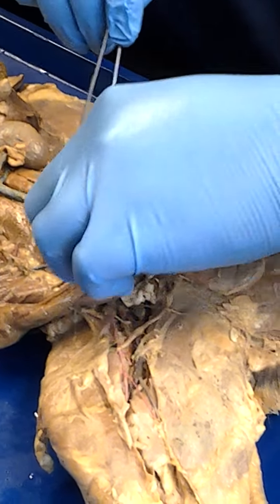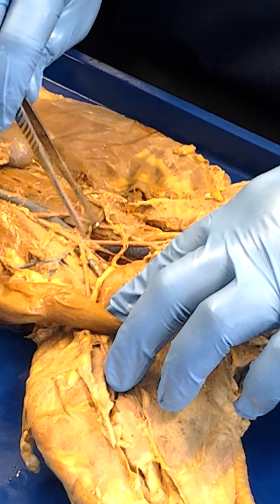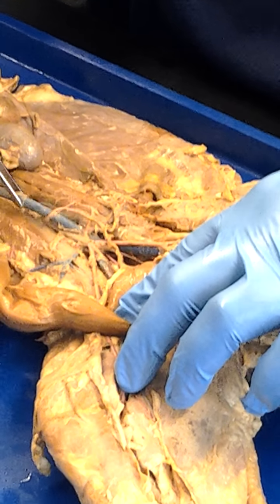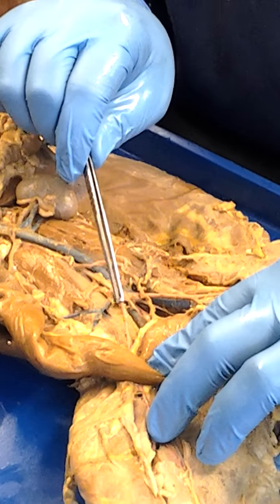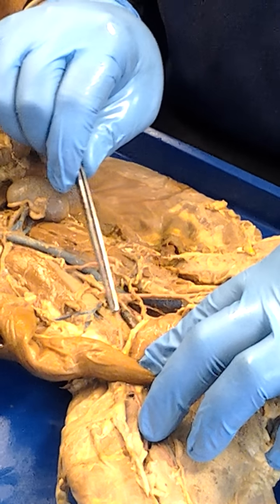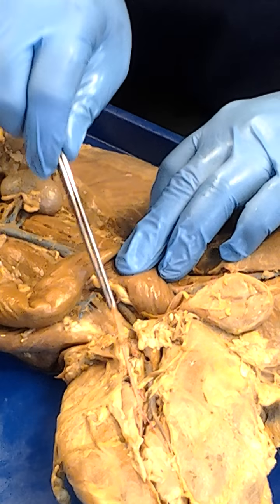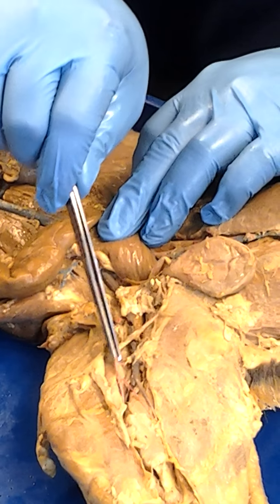Now, as we move downward, we'll see here that there's a blood vessel that comes off of the aorta, as well as two that come off, merge into this inferior vena cava. So here's the inferior vena cava. Here is the abdominal aorta right there. You'll see that there's a branch right here that comes off. Look at that. Right there. And it's going to come over, and it's going to come this way, and head towards the leg. So this is the external iliac right here. And then it turns into the femoral right here.